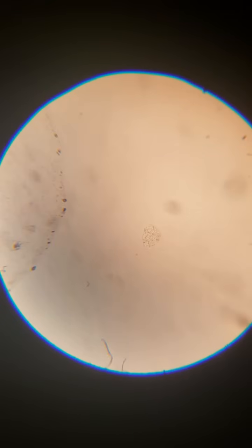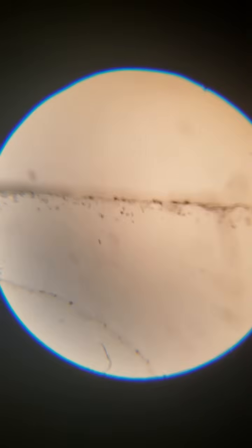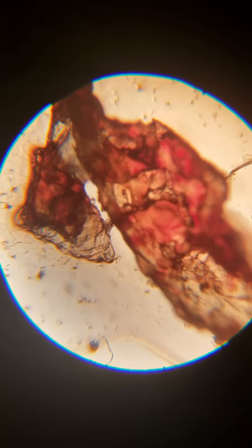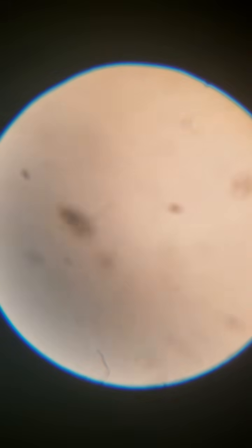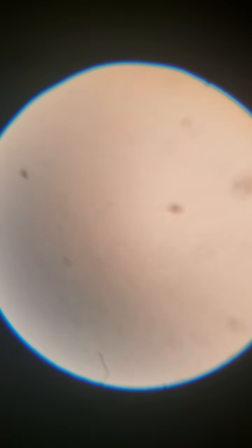Now, the last thing I'll show you before we hop back to looking at the sponge is, and I apologize if this is boring to some of you, but hopefully somebody will dig it. So this is from me. This is a blood sample. Now it's drying quickly. And I have an autoimmune disease, so my blood samples may be slightly different than yours. But for the most part, when we look at dried blood under the microscope, let me reorient this real quick so we can see that. All right.